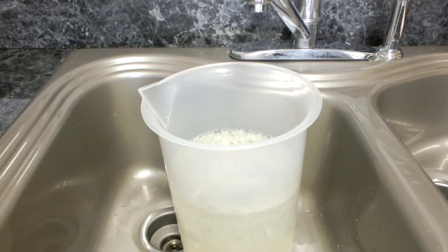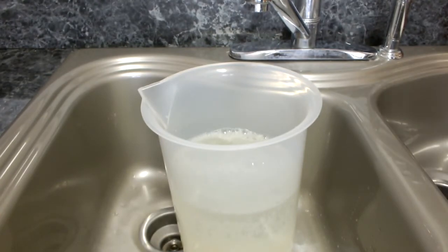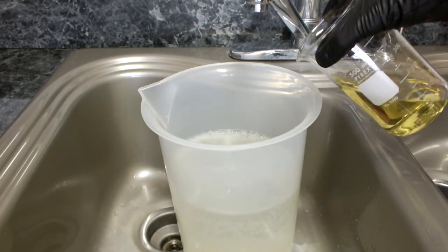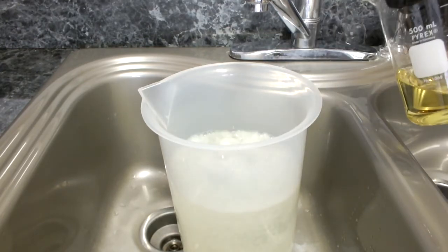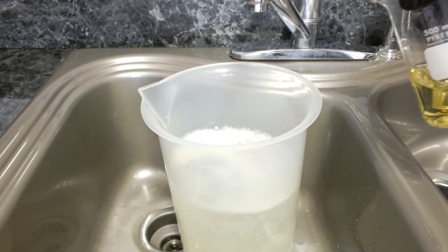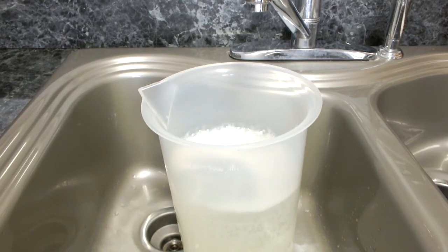This does produce a fine mist of everything in this cocktail, including the acid, so don't breathe anywhere near this reaction or your lungs are going to hurt. And you can't just rinse those off. Once the bubbling stops, flush this whole mess down the drain and rinse out your beaker for the next neutralization. I did each run's waste in fresh bicarbonate solutions just to make sure they've been neutralized properly.